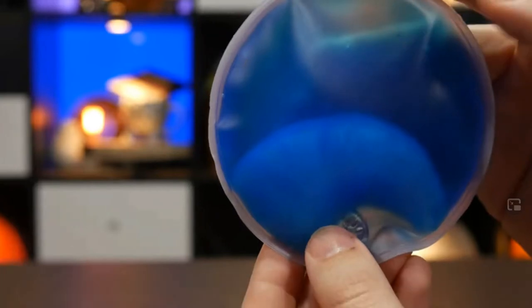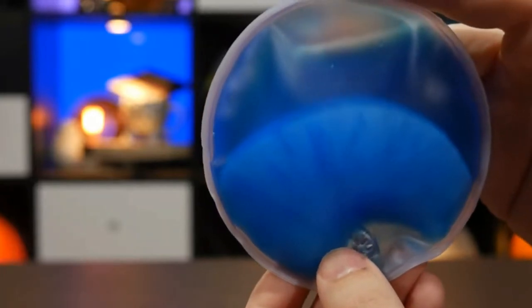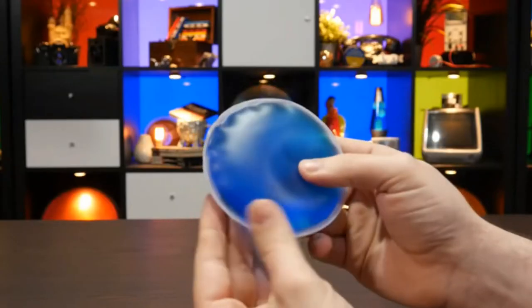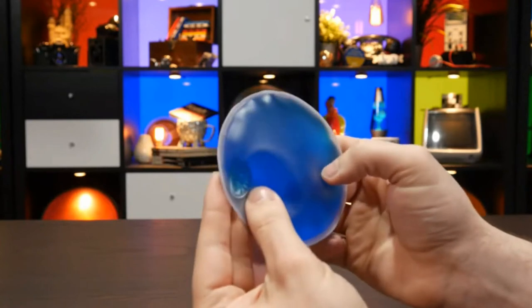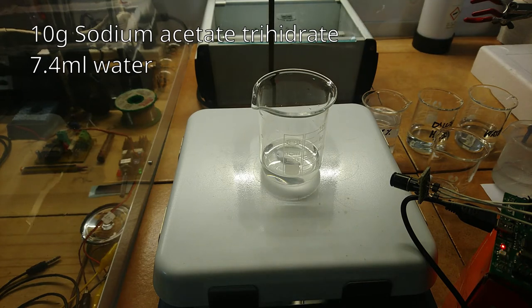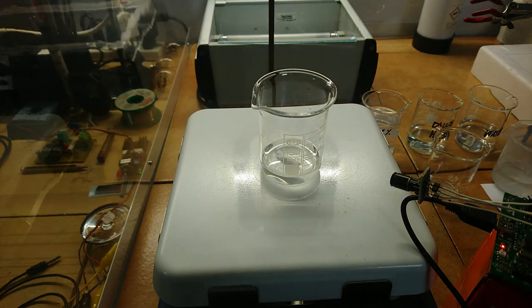I recently watched the Technology Connections video about hot ice and warmers, and noticed he didn't try to make them from scratch, unlike in the lava lamp video. But then I realized I haven't done this experiment myself either, so I went in the lab, looked up the solubility table for sodium acetate, cobbled up a makeshift thermal camera from random stuff I had around, and tried.